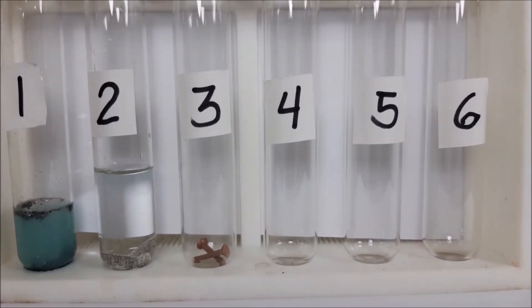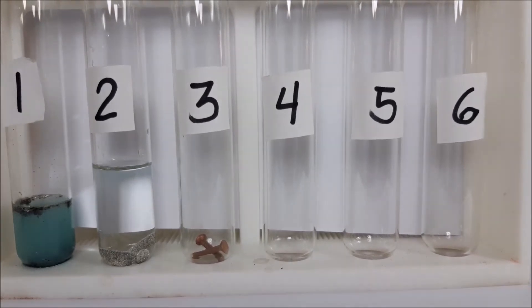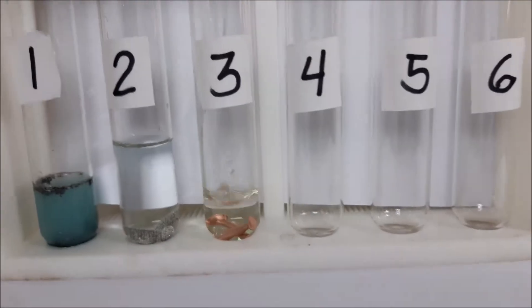For test tube number three, I put copper and then we will add hydrochloric acid. Let's observe what will happen.